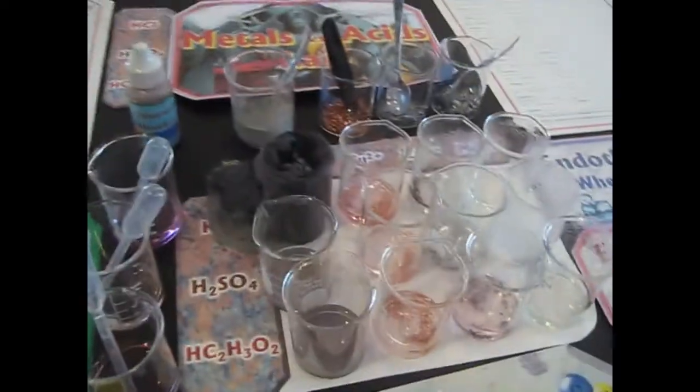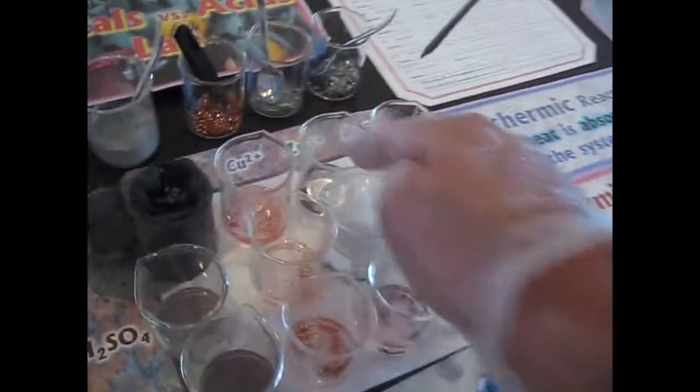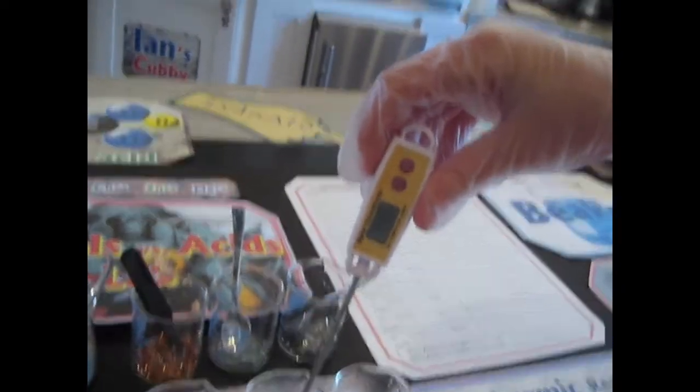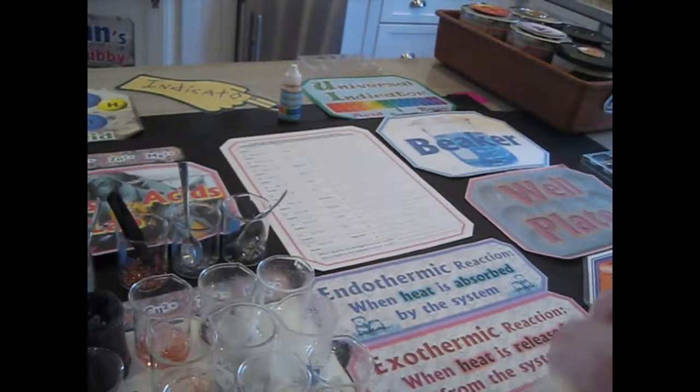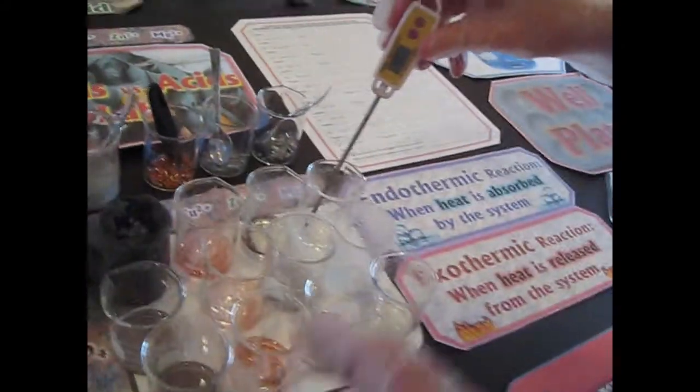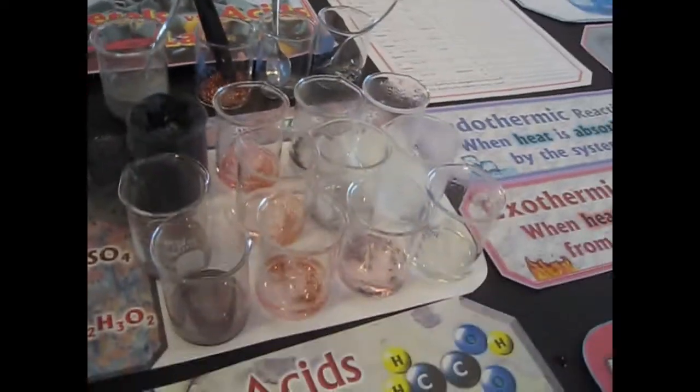Okay, just get as much off as you can, and then let's get a few more temperatures. We didn't get the temperatures in this row, so let's get this temperature. And again, these are not the maximum, but 47. It's going up. So all we really need to know is whether it went up or down. Let's try this one.